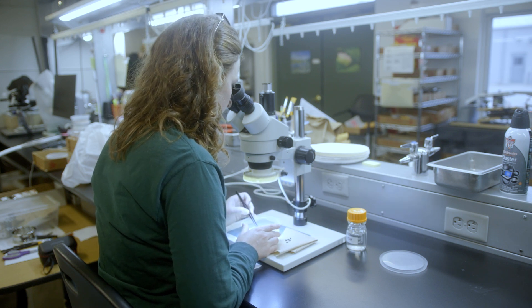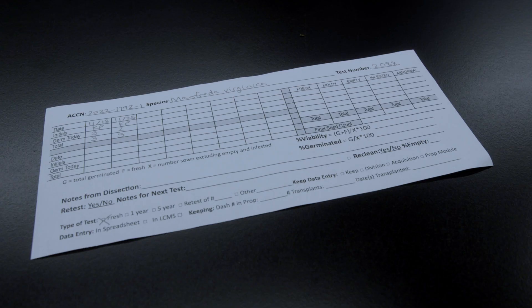When scoring the test, take note of the date, the initials of who scored, how many seeds germinated that day, and a running total of seeds germinated.